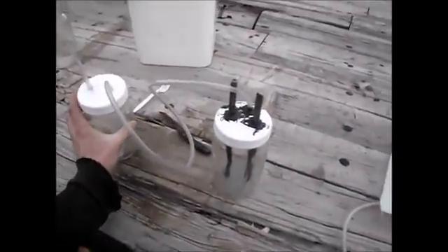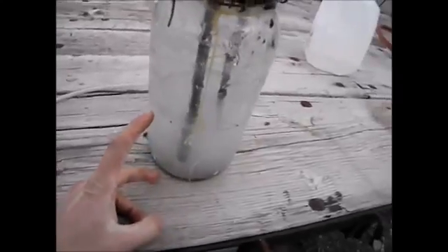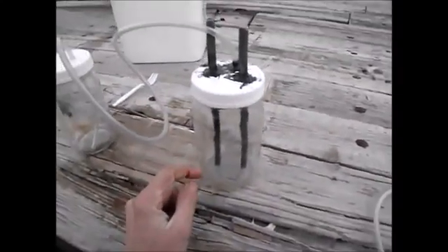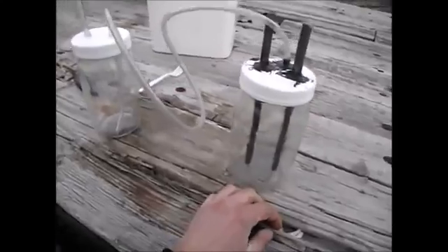I've got this one here. It's a little smaller — this will hold about one quart of solution. It's got the same lead electrodes here. I'm gonna go ahead and distill this down, get rid of the sulfuric acid, concentrate it down, get the concentrated sulfuric acid, and take the vapor and get distilled water. I'm gonna put the distilled water in here, and for the electrolyte I'm gonna use magnesium sulfate, or possibly potassium sulfate, depending on what I feel like at the time.